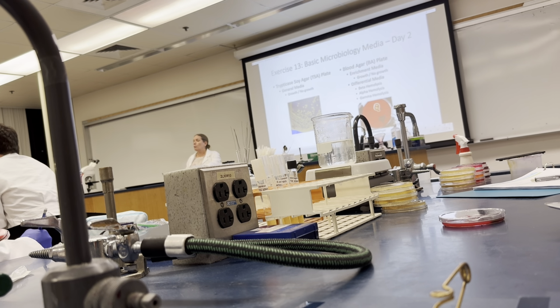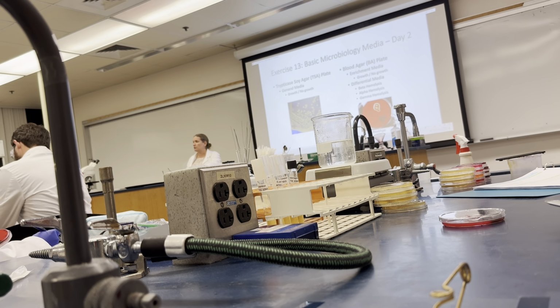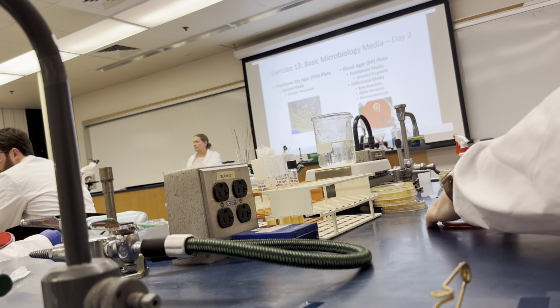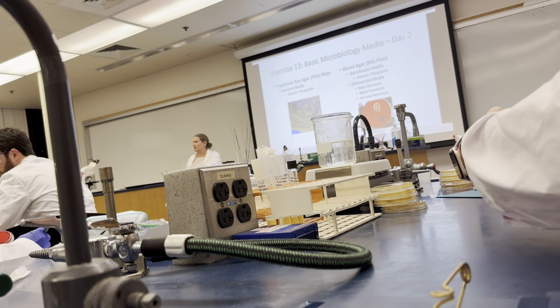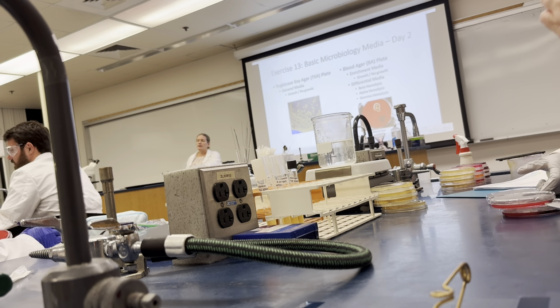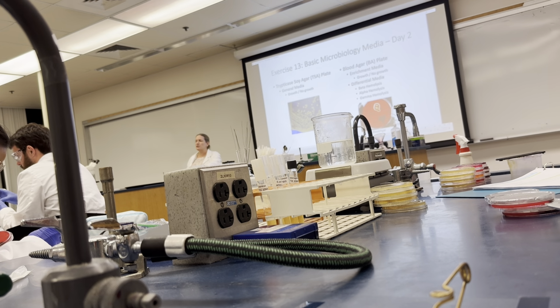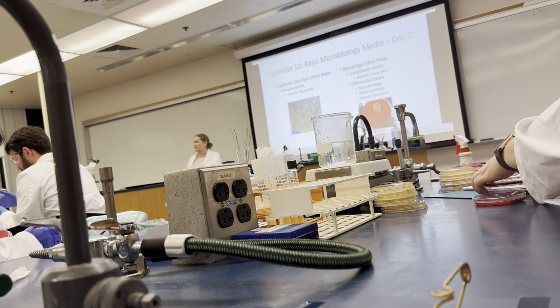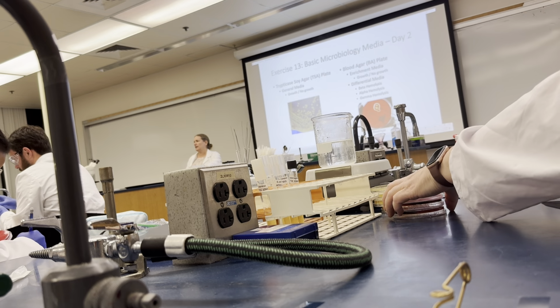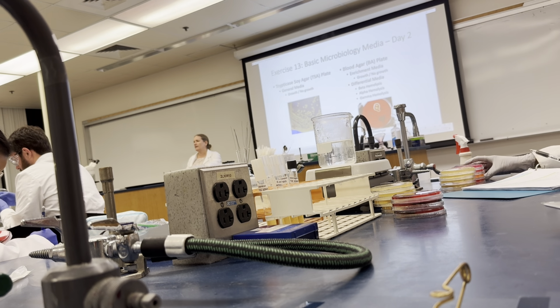Which one showed beta hemolysis? Staphylococcus aureus, that's what I put. Absolutely. We're going to do a lab later in the term. I'll tell you, it's kind of sad. Scientists are so mean. There's a toxin Staphylococcus produces called alpha toxin, and alpha toxin causes beta hemolysis. Man, they should just call it beta toxin, right? We make their life so much easier. But no, it doesn't go that way.